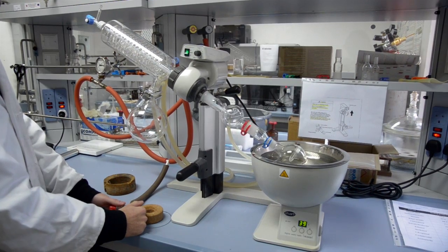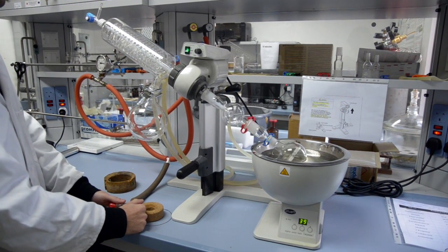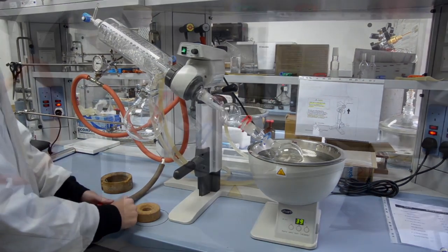Once condensation is observed, you can stop closing the valve. A cloudiness appears within the condenser or one can see some evidence of evaporation.